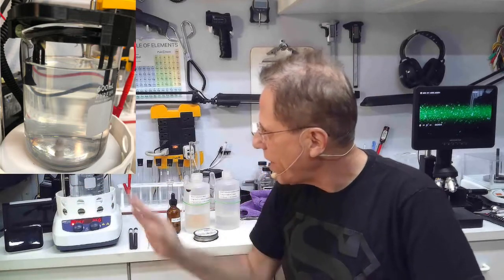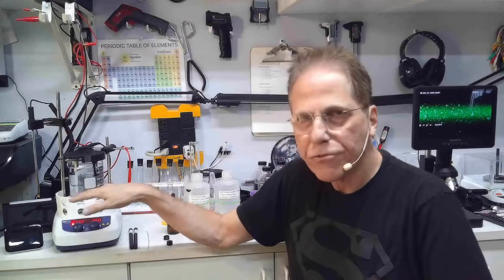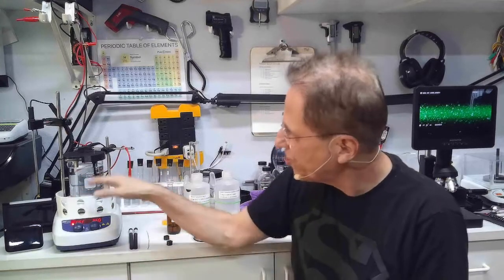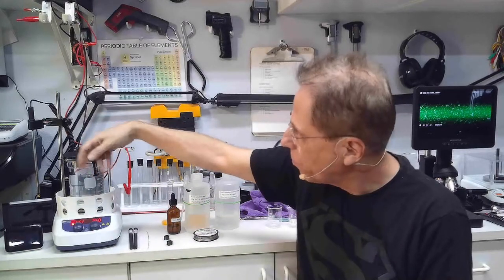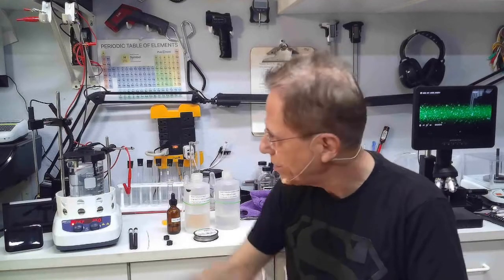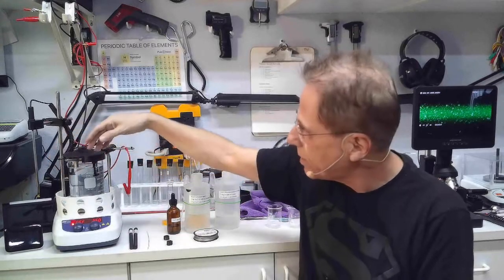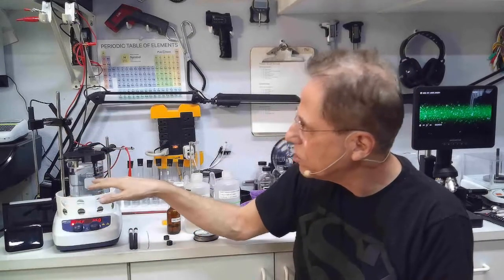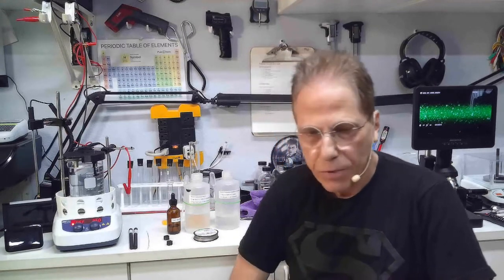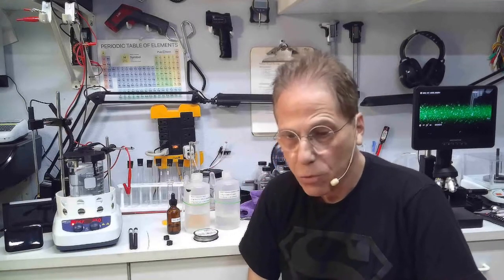You can't quite see it, but there's a very faint milky color to the solution. It doesn't change to any other color — you just get this light milky color. Once you reach that, no more material goes into the fluid. What happens is you'll get white flakes floating around — titanium hydroxide is white. If you continue past 40 minutes, you'll just get more white flakes; that material can no longer become colloidal and starts clumping into larger pieces of titanium hydroxide that you'll need to filter out.